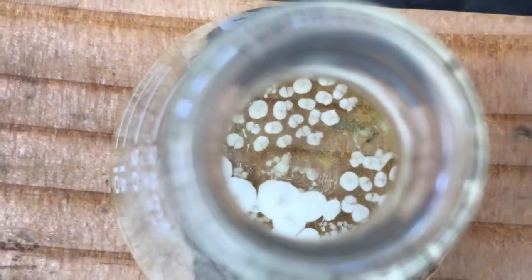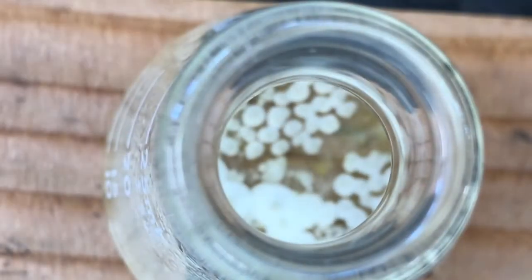And I'm seeing yellow crystals. I want white crystals. Interesting. Maybe I'm just seeing the white crystals as if they're yellow. Oh, look at that. There it goes. Sweet, sweet, sweet. As I disturbed it, it just started going. Cool. This is live, real time.